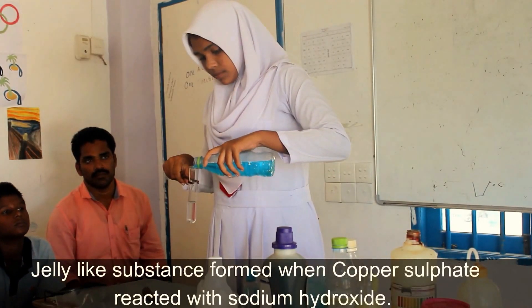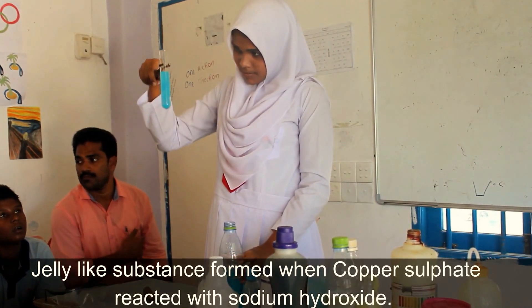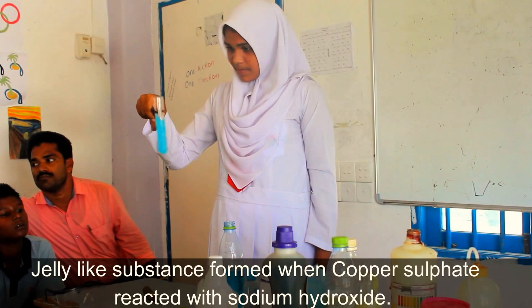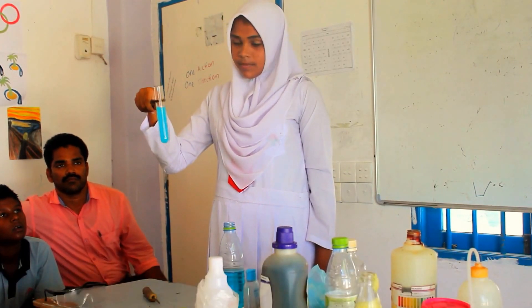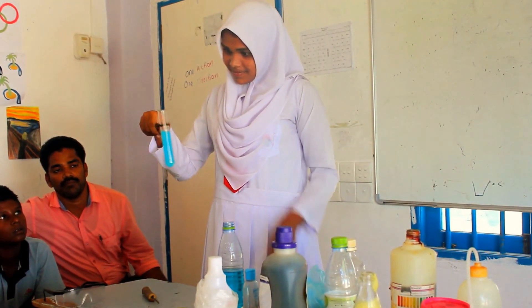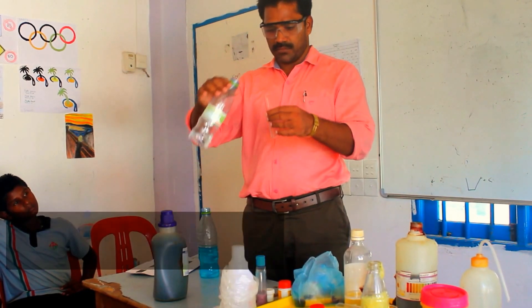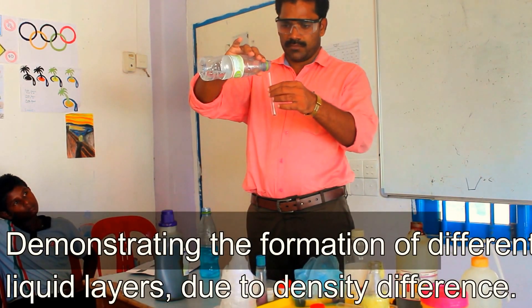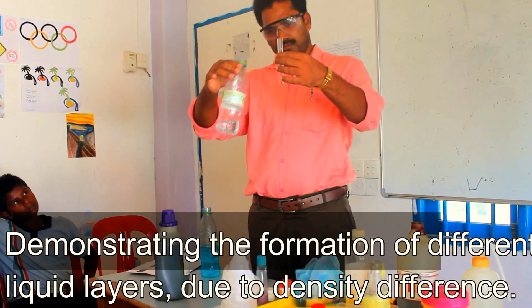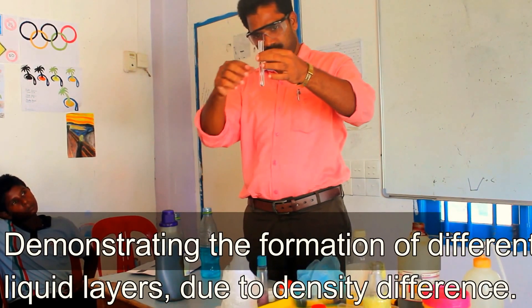Students are shown the gel formation of sodium hydroxide and copper sulfate solution. Here, a demonstration shows the formation of different layers of liquids due to the difference in density.